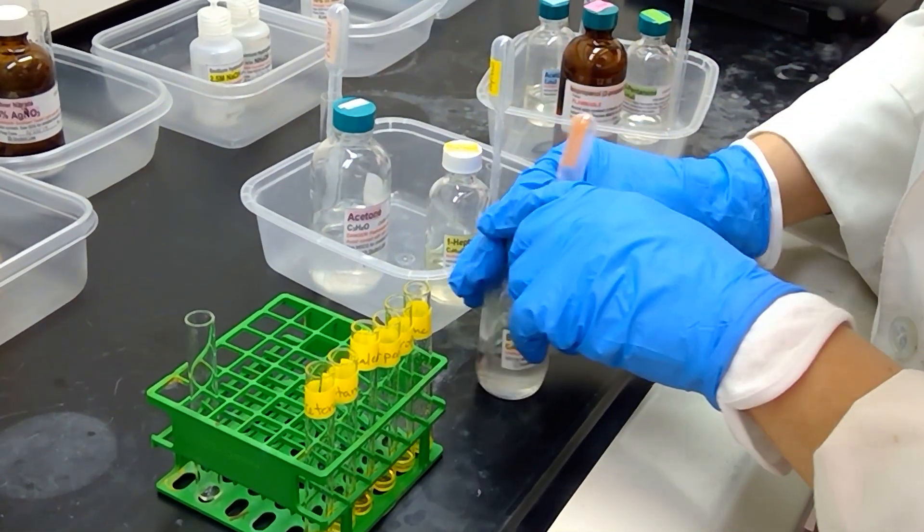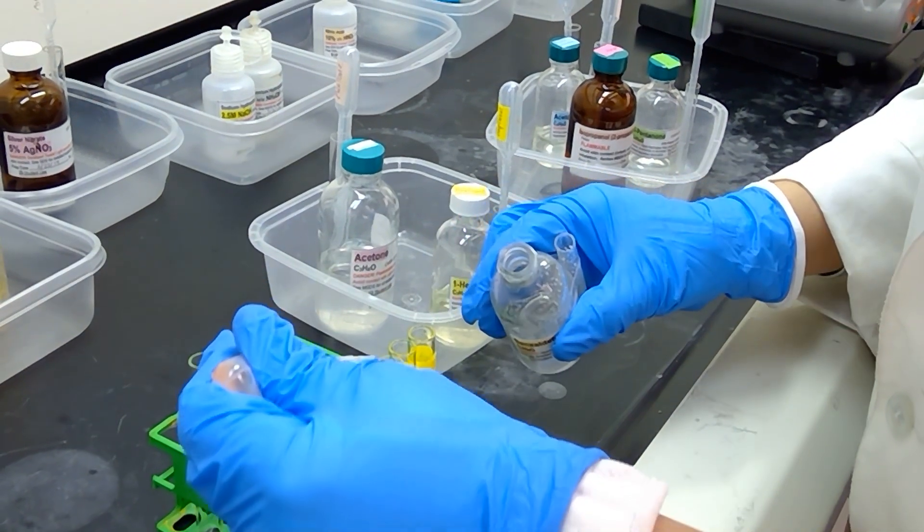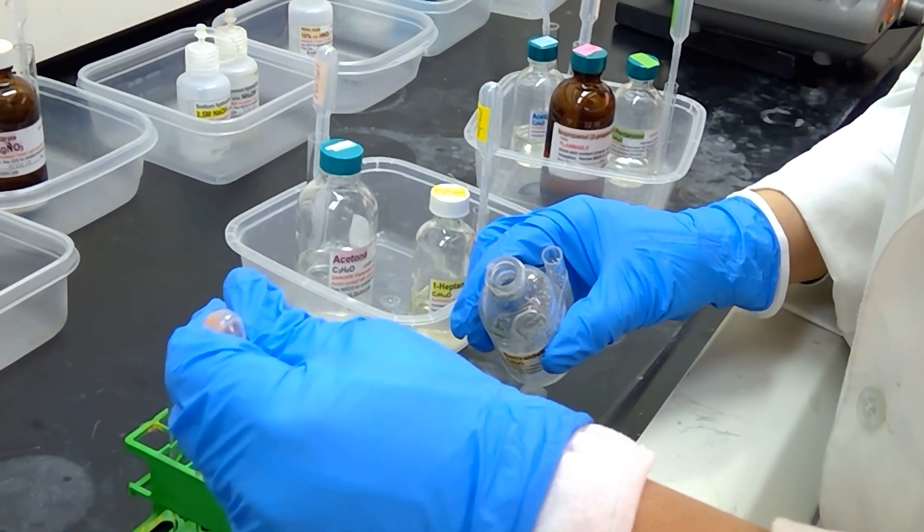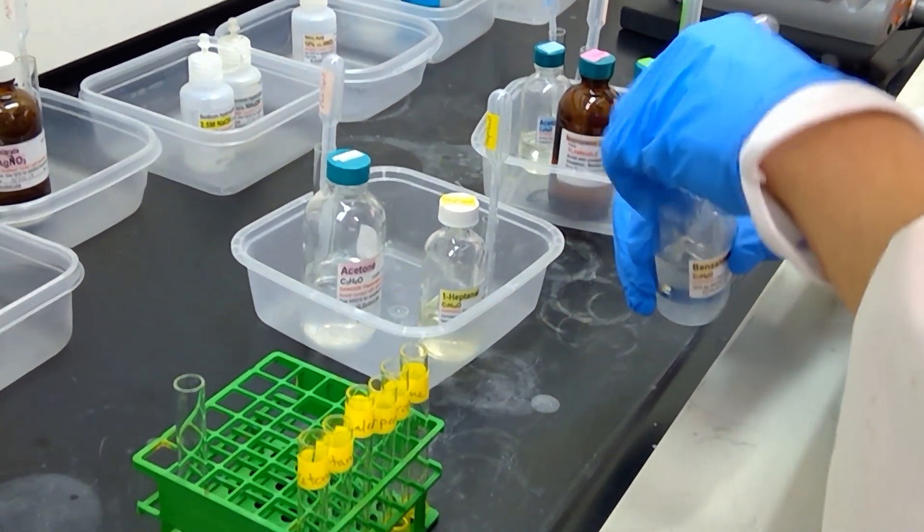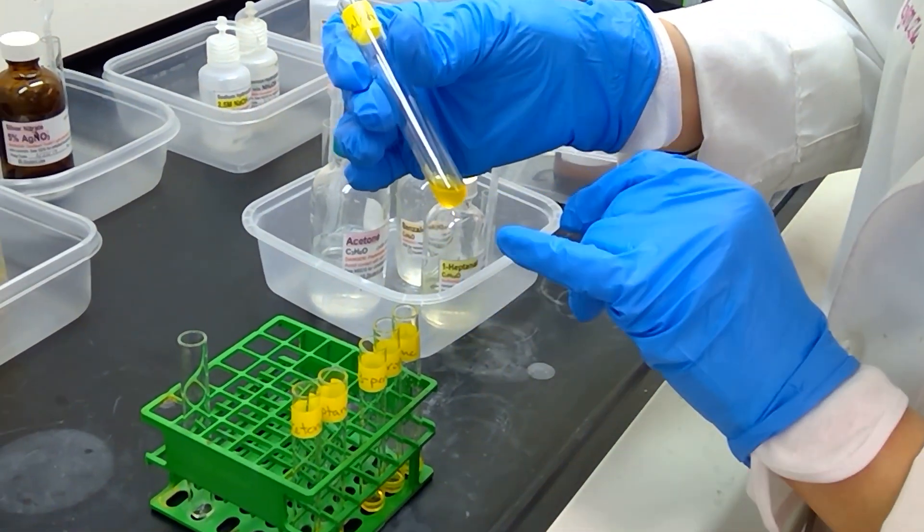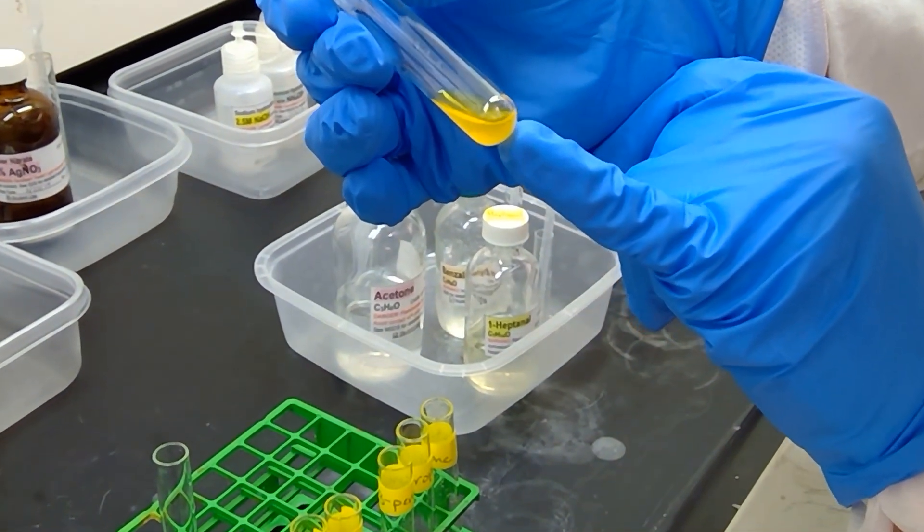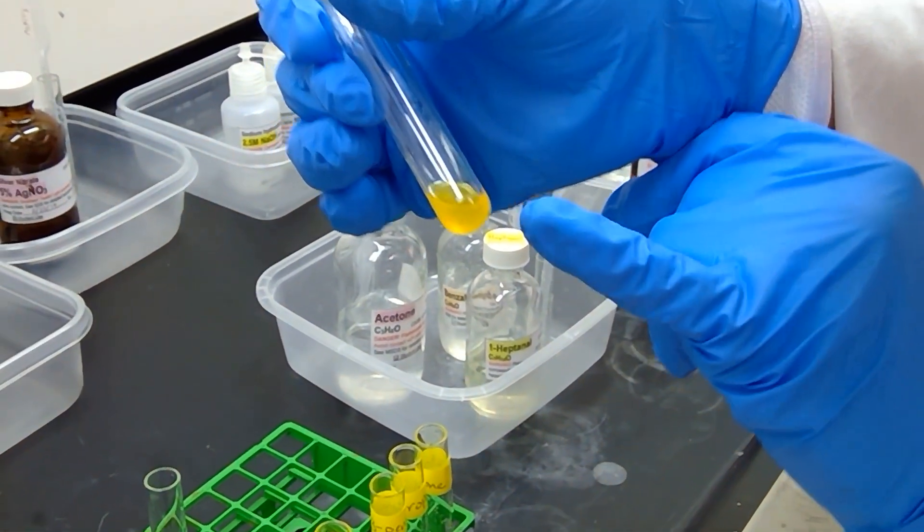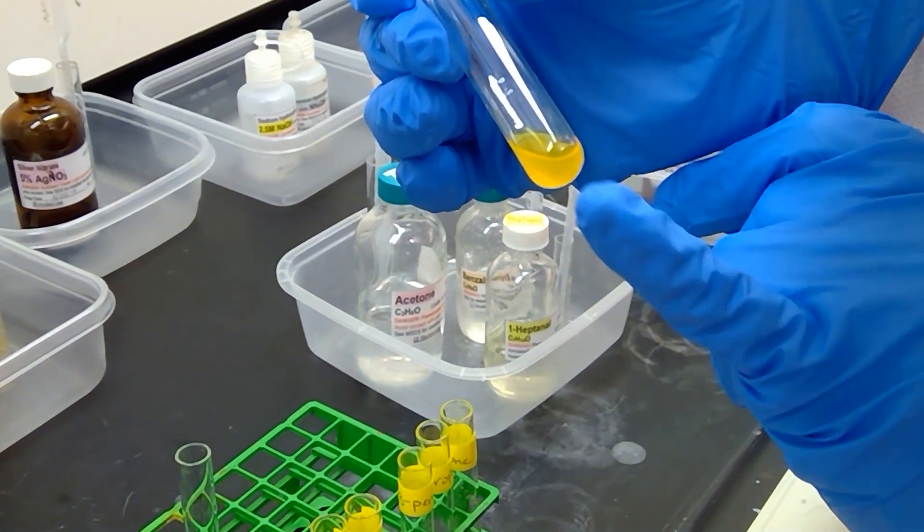Let's add some sample to benzaldehyde. That last little drop just didn't want to fall. I'm going to shake this one up as well. See how it looks here. And this one made a precipitate at the bottom right away with a couple of red flecks happening down at the bottom of the test tube. So benzaldehyde is definitely positive and giving us some reddish flecks at the bottom of the test tube.